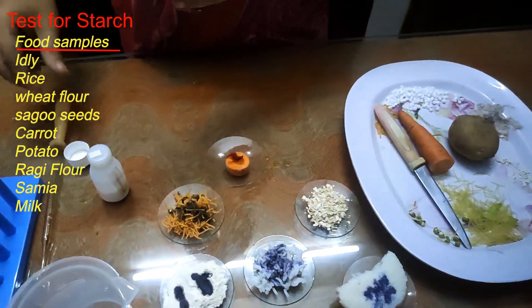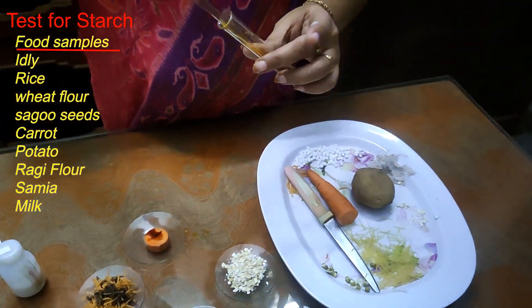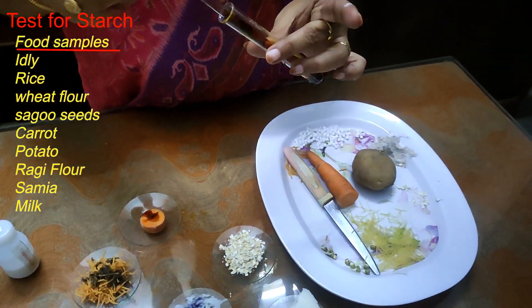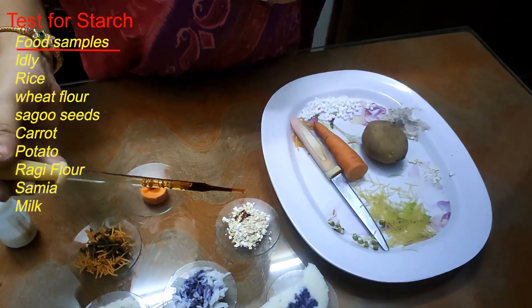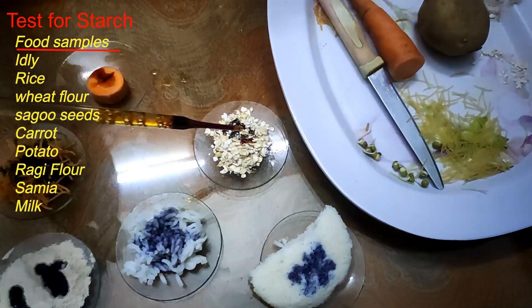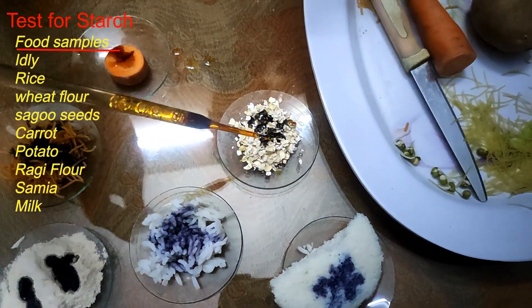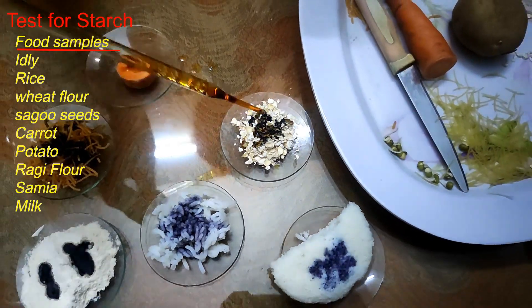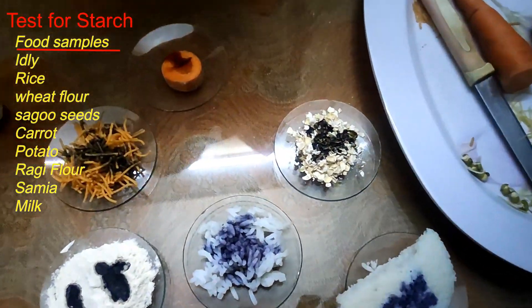Here are some more items. I am taking oats and adding a few drops of iodine on them. They too contain starch, so they also change to black color.